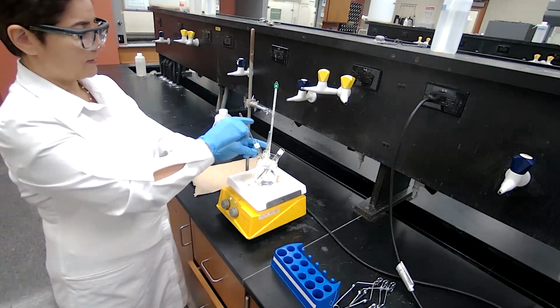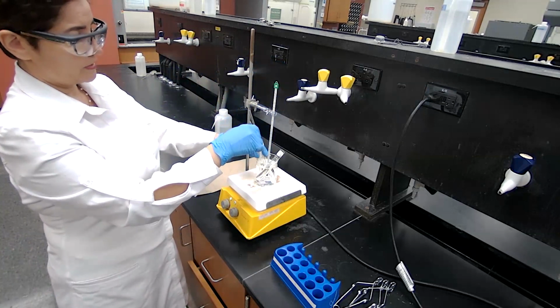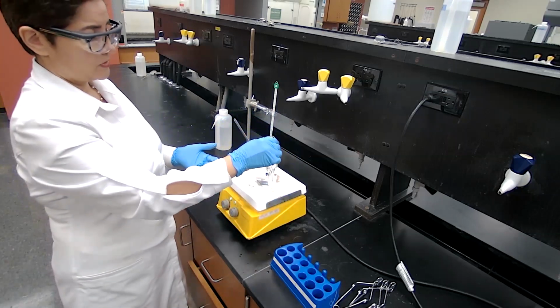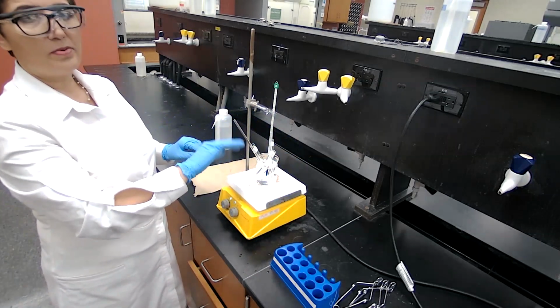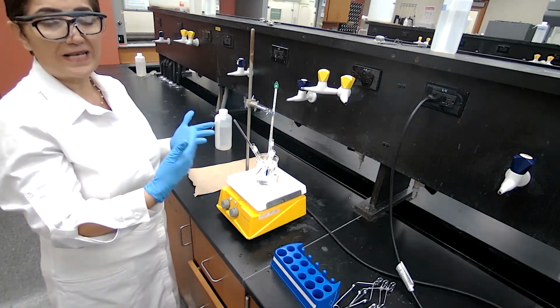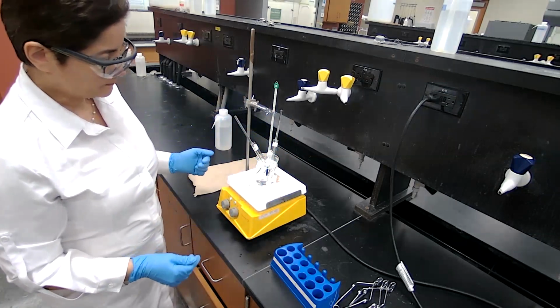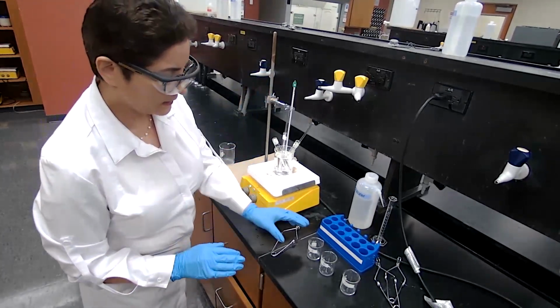While this is being heated for the 20 minutes, I'm going to stir occasionally, as I said, and also prepare 3 small beakers with cold water, because after the 20 minutes, we're going to pour it into the cold water in a beaker to test for the odor of the ester. So for this 20 minutes, we are going to pause the video and come back. Okay, it has been about 20 minutes and the temperature is around 80 degrees.